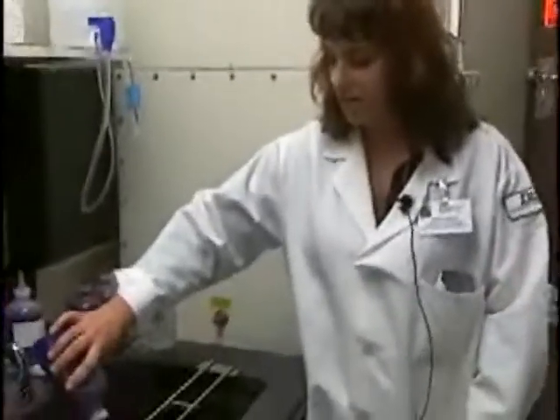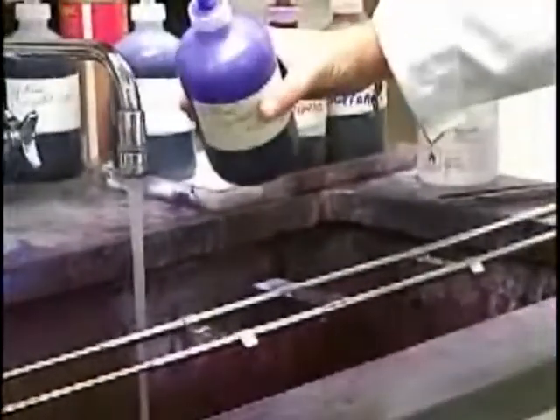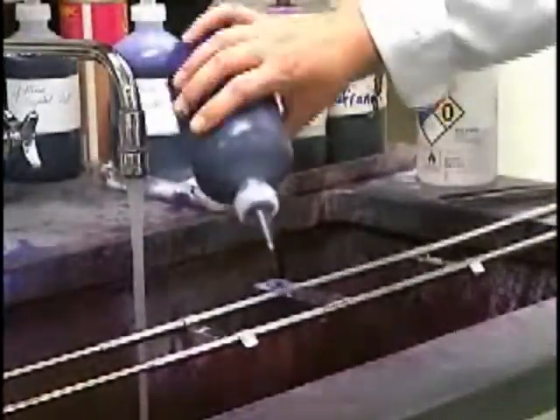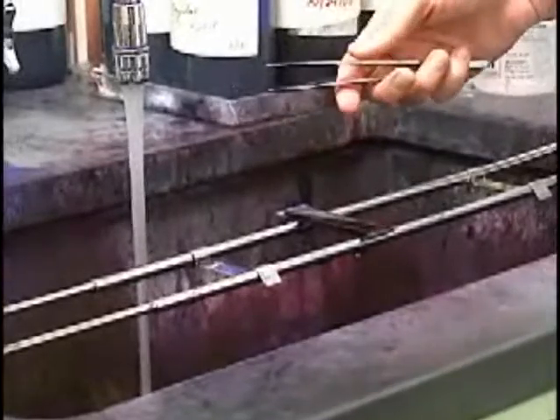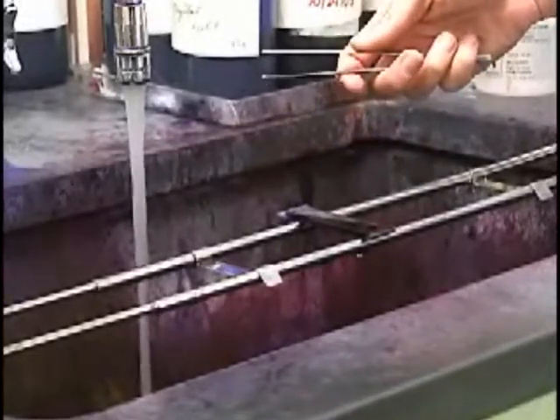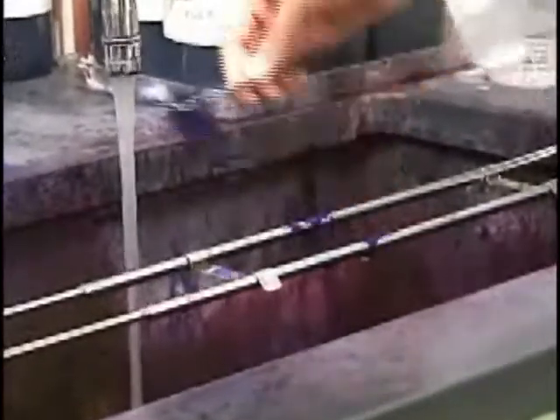The first stain that we put on is called crystal violet. This is the initial stain. This slide here is a heat-fixed slide of organism. We place the crystal violet onto the slide for 10 to 60 seconds. It stains all of the stuff that's on the slide — it will stain cells, it will stain bacteria, and any debris such as protein that could be on the slide. After the time, we rinse it off with water.